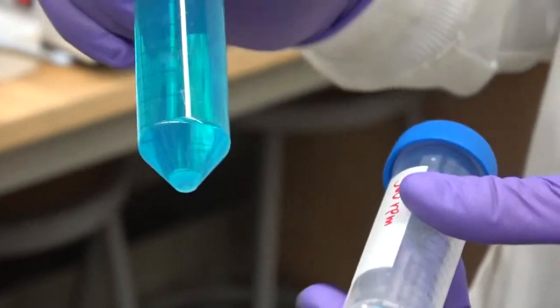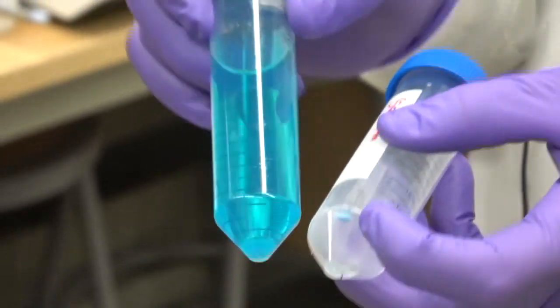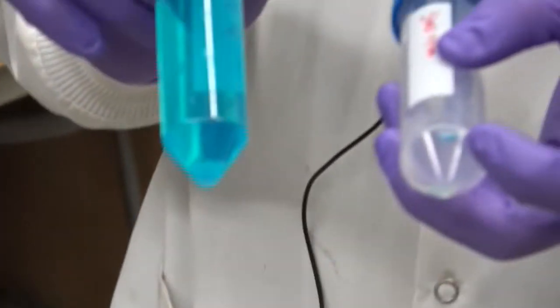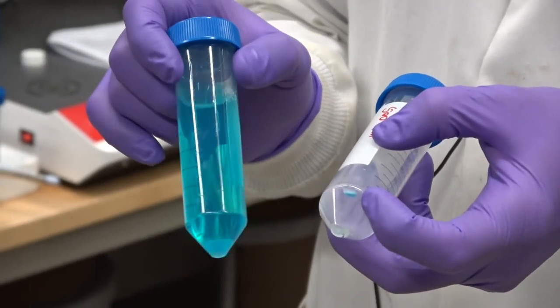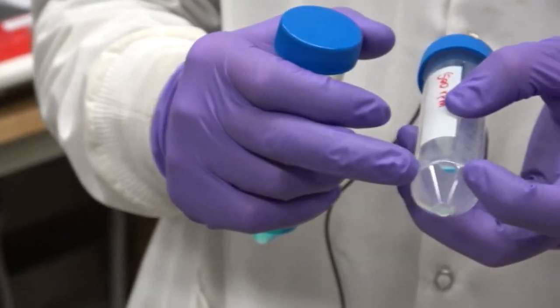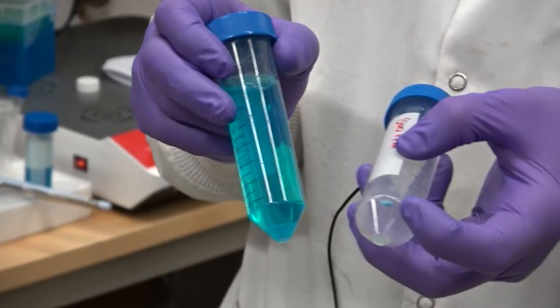And so, as you can tell, a lot of the material is actually not encapsulated, right? This is totally a function of the solubility. For example, I was making these PLGA particles previously with a very hydrophobic material, and almost all of it was encapsulated inside of the nanoparticles. But here we're getting a relatively small fraction.